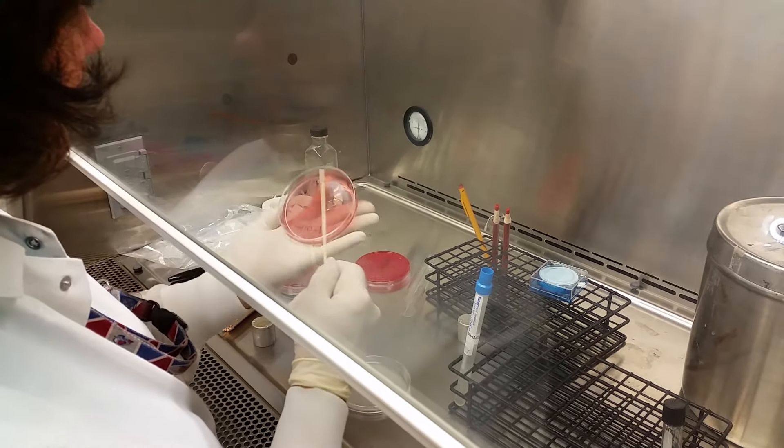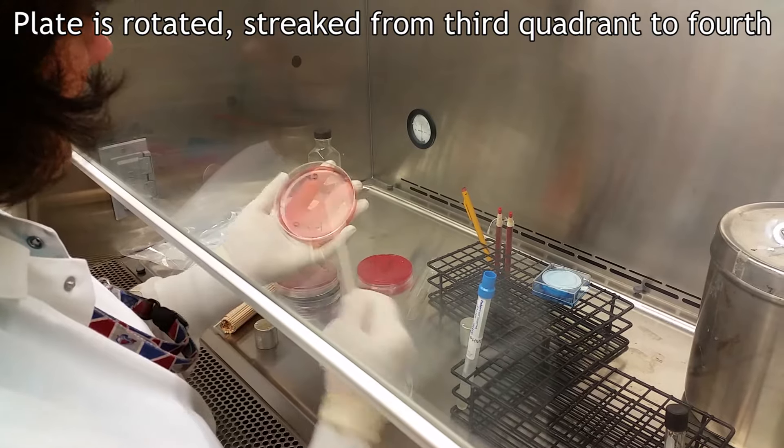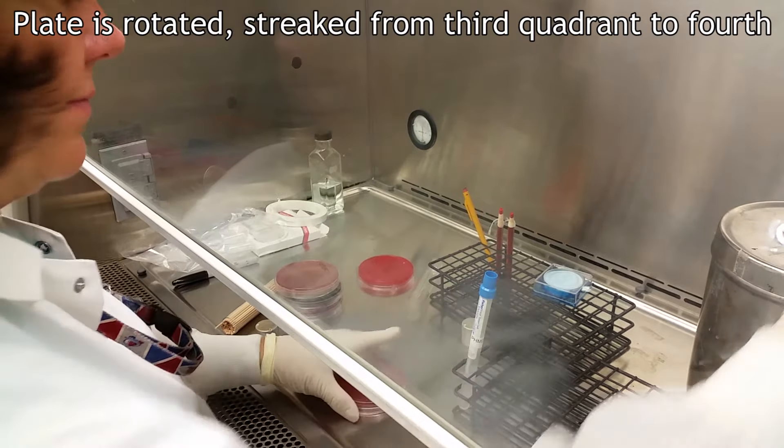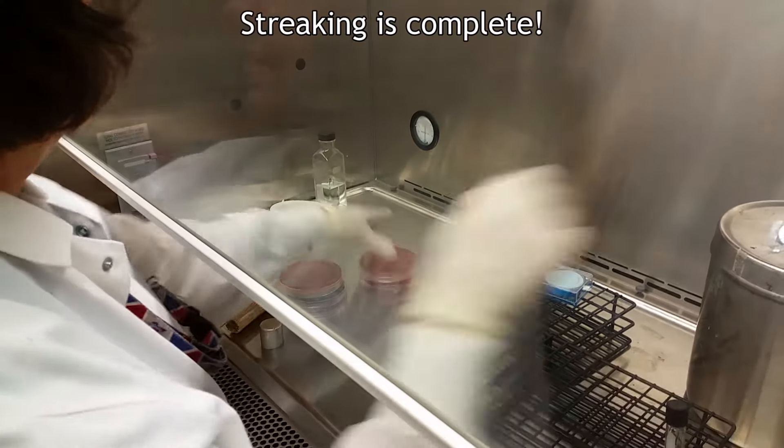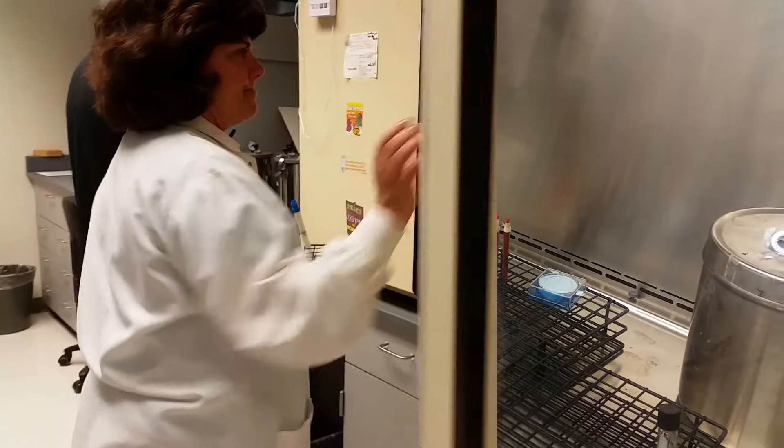With one last rotation, the plate is streaked from the third quadrant into the fourth and the streaking process is complete.